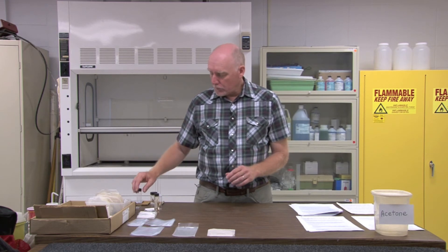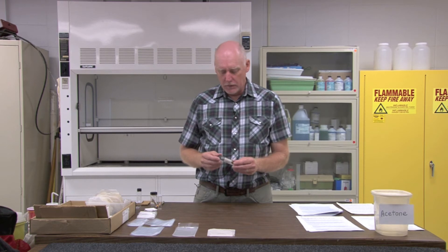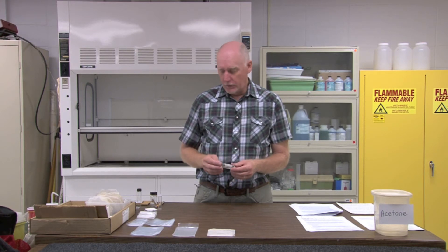The alcohol and the nymph in the vial are included with a date-location label in which you would write all pertinent information, including the species if you know what it is, who collected it, who determined it, and so forth.